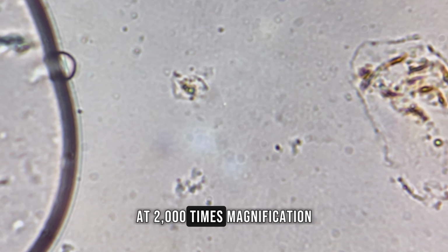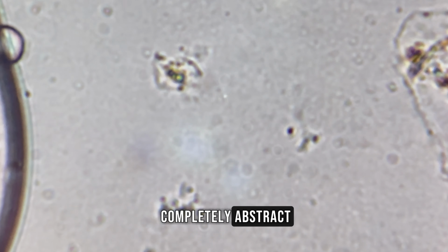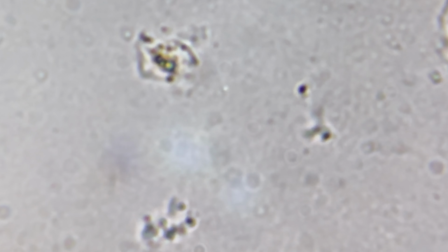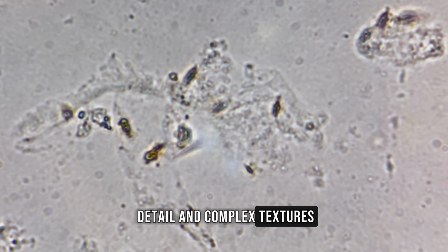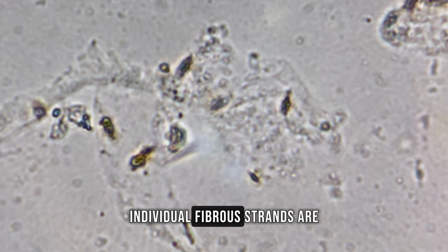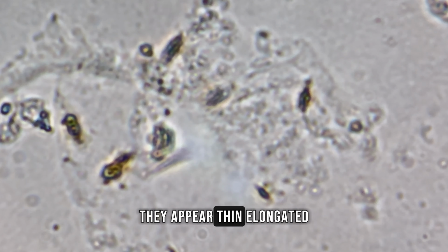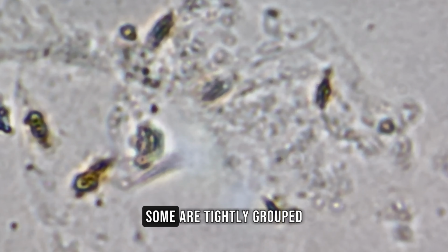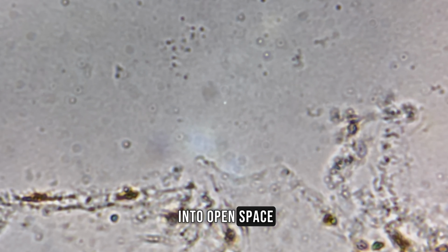At 2,000 times magnification, the mandarin becomes almost completely abstract. Nothing here resembles a piece of fruit anymore. The field of view is filled with fine detail and complex textures. Individual fibrous strands are now clearly visible. They appear thin, elongated, and irregular in direction. Some are tightly grouped, while others drift apart into open space.